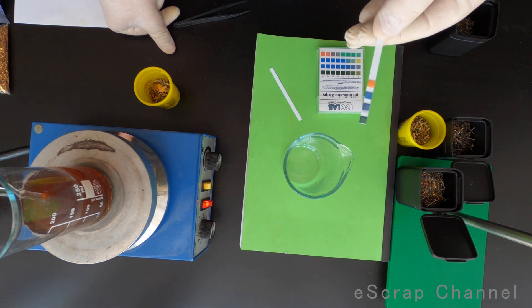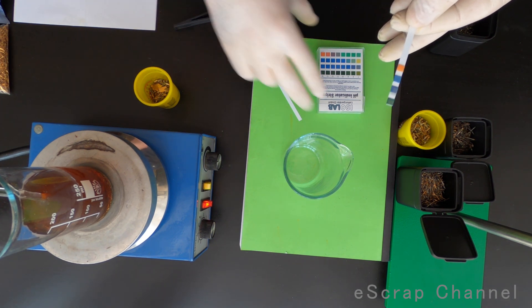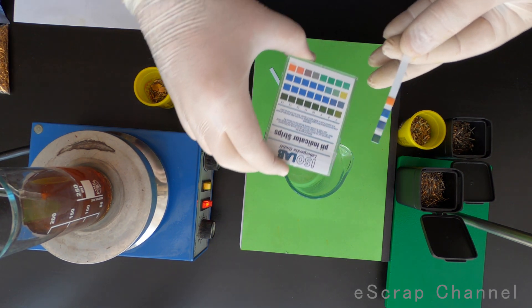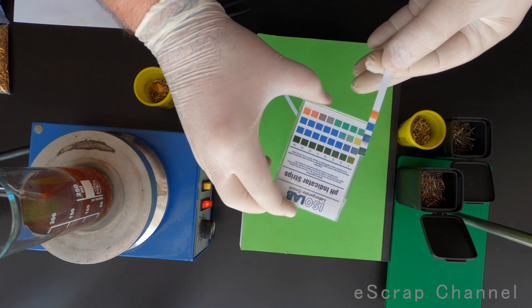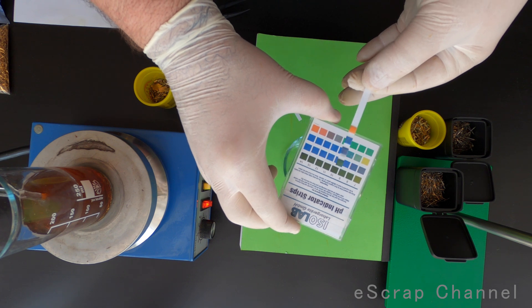Meanwhile, I've decided to check the pH of this solution. I want to know, is it acidic? Is it alkaline? What is the pH? Is it important when you work?